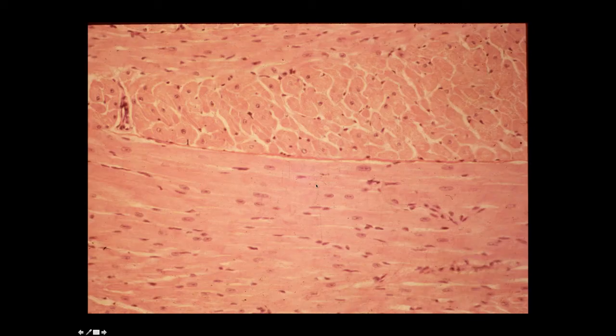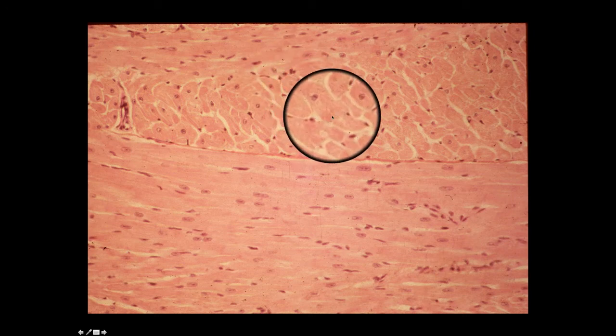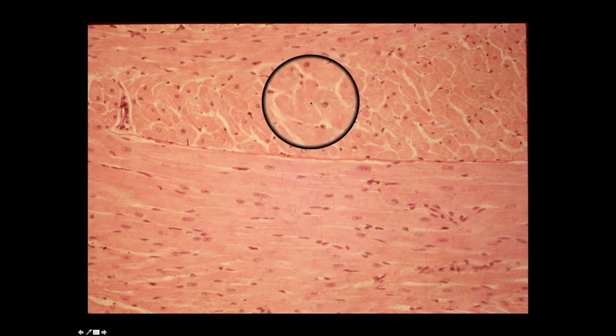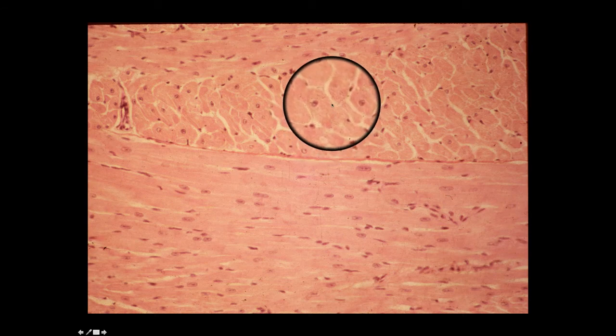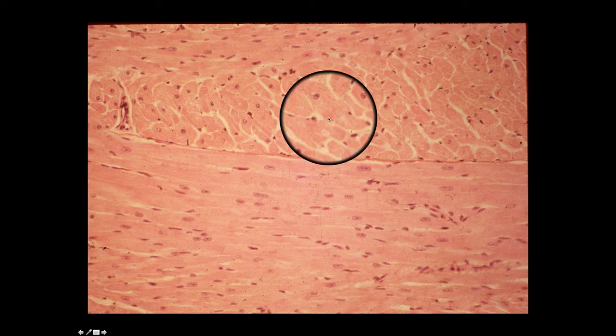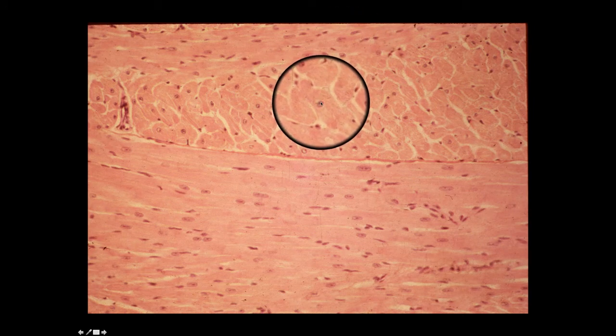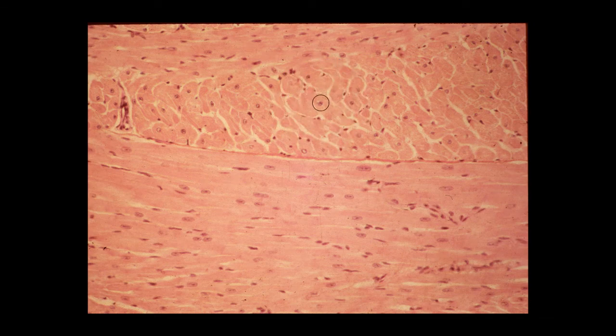Yet again another view of cardiac muscle, both in longitudinal section on the bottom and in cross section towards the top of the image. Look at the size of the cardiac muscle cell as I'm tracing it like this. The size of the cardiac muscle cell is quite a bit bigger than the size of smooth muscle cells. These are about the same magnification as the images I showed you on smooth muscle. Look at the size of the nucleus in the cardiac muscle cell, and remember that in relation to the size of the nucleus in the smooth muscle cell. And I'll make another point about that in just a couple of minutes.